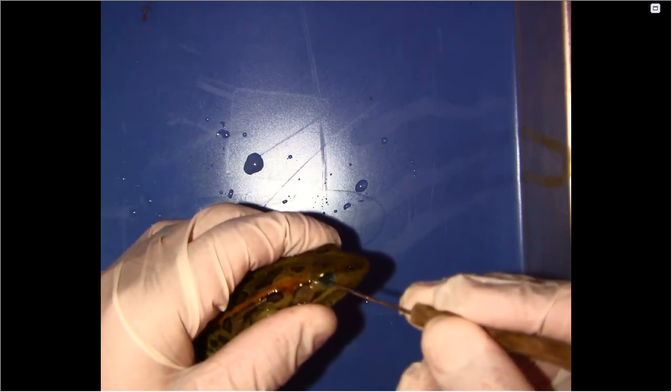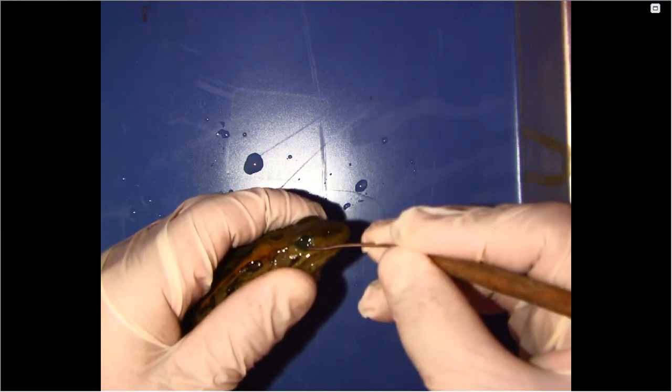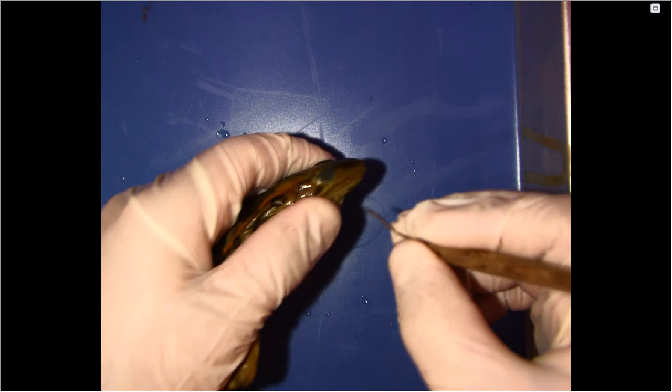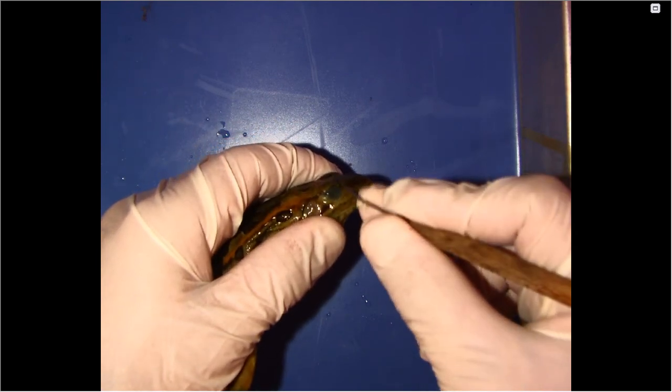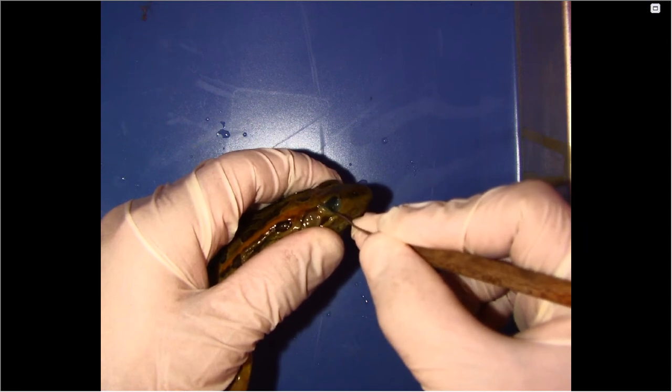So take a look at the outside of the frog. And the frogs, if you see here, they have an extra little covering on their eye. It's sort of like a goggle for them, right, to protect them as they are either diving underwater or kind of hanging out underneath there. Okay, so they have that protective eyelid there.